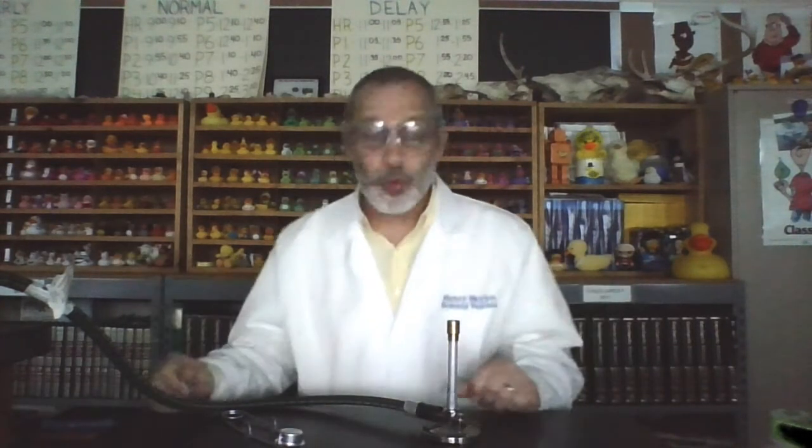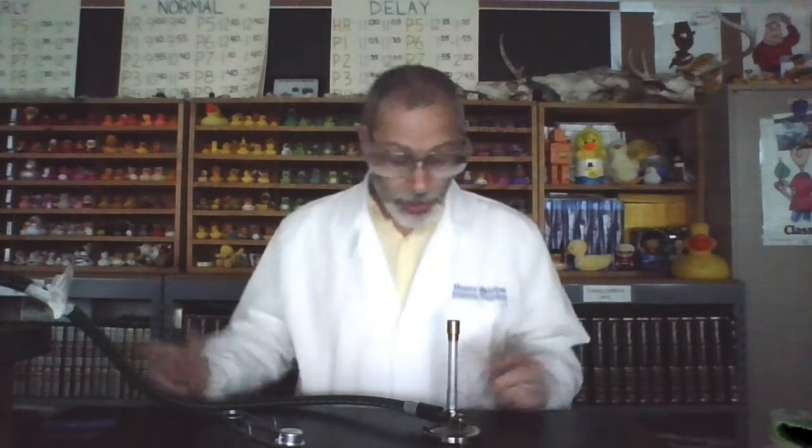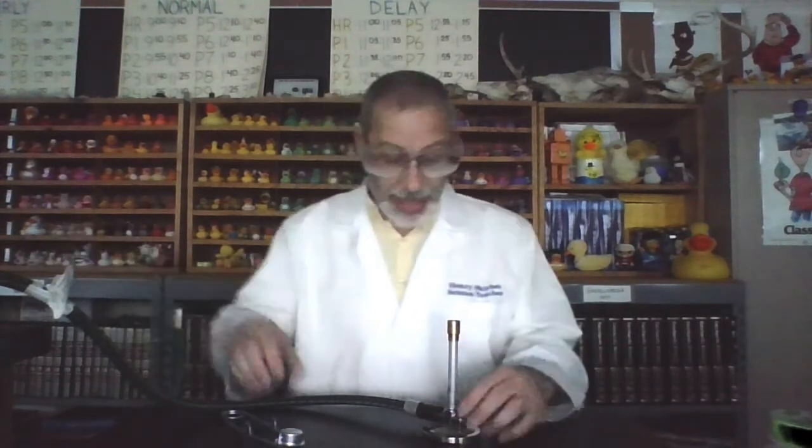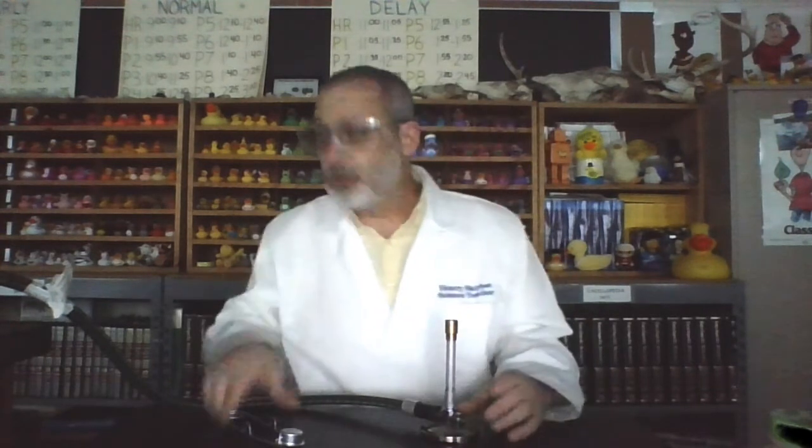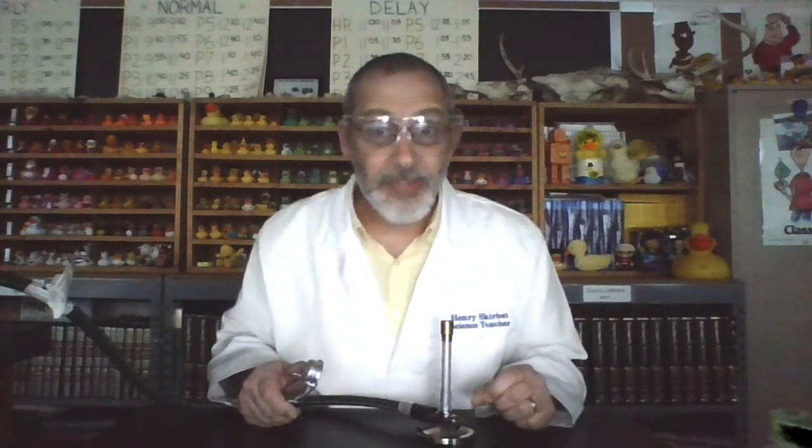So I have the Bunsen burner set up before me. I've got my safety goggles on. I've got all of the safety equipment provided in the classroom, and we're all ready for this flame test lab. So the first thing I'm going to do is light up the Bunsen burner. I'm going through all of the steps here as we discussed earlier in the year. Good idea for you to be reviewing the steps on lighting the Bunsen burner as well. And so now, turning the system on, I now have the Bunsen burner lit.